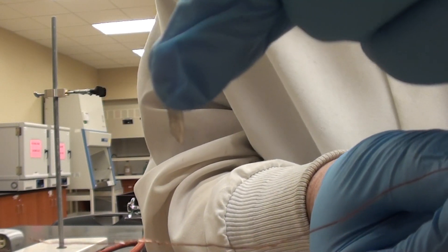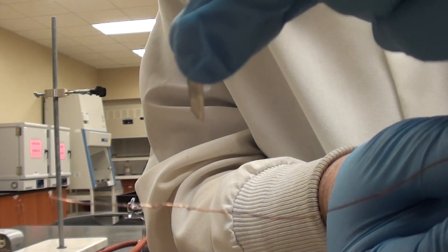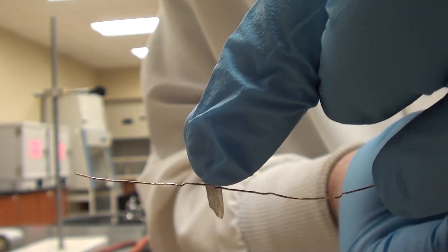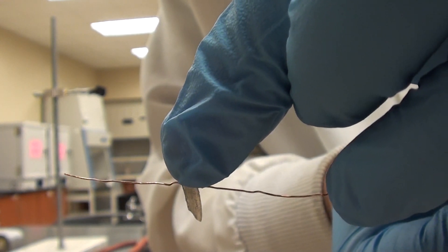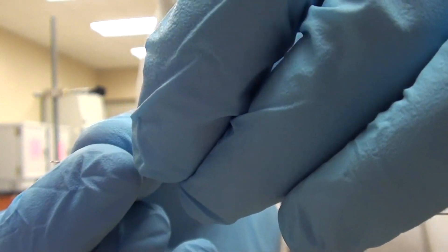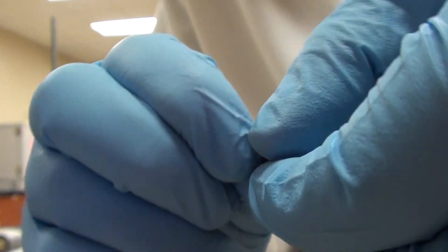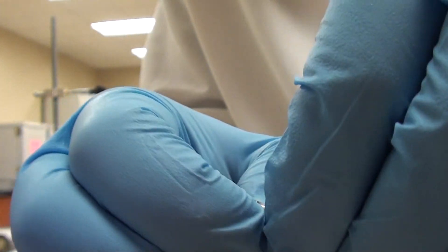Over here I've got my magnesium that I cut earlier. What I'm going to do is I'm going to wrap this around the copper wire, probably about one to two inches down from the top. No more than that because I need a bunch of copper wire at the end. So now I'm going to go ahead and wrap this around the copper wire. Sort of a loose-ish ball. Just put this up like this as well, that will stop it from falling off the end.